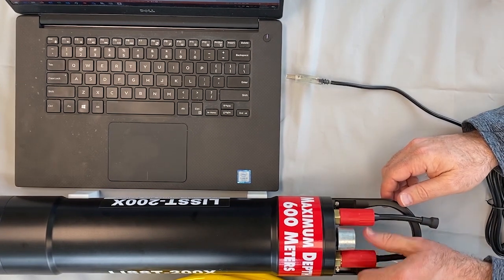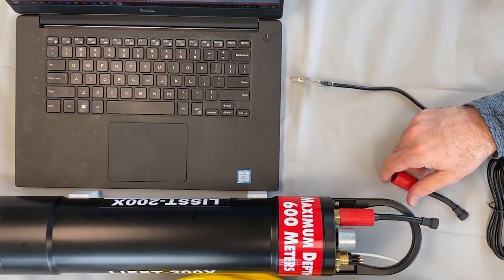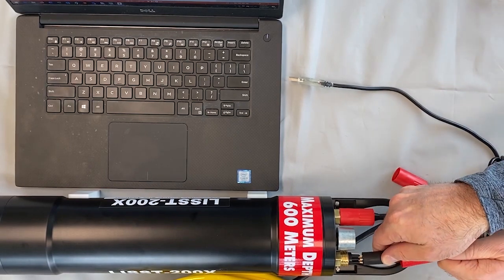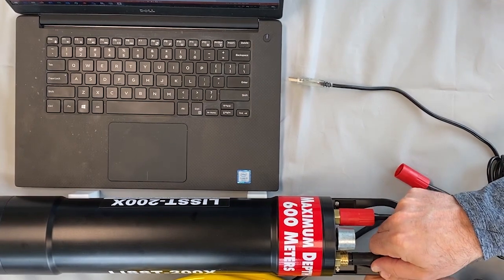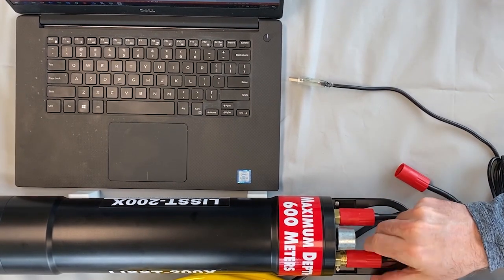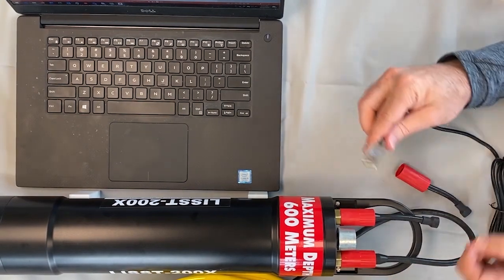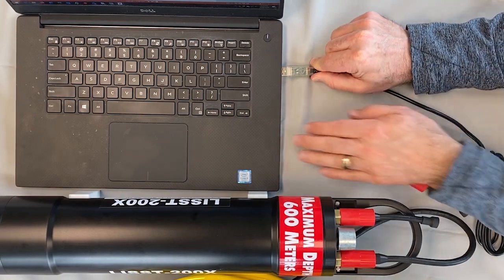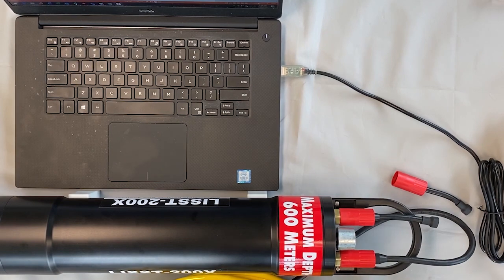Loosen the red locking sleeve and pull the protective cap straight off the bulkhead connector. The communications cable has a 5-pin connector that mates with this bulkhead connector. Orient the cable to line up the pins on the bulkhead connector and push the cable fully onto the connector. Install the locking sleeve hand tight. Insert the USB end of the communications cable into the USB port of the computer. You should see a light flash on the cable and may hear a sound on the computer as the USB connection is established. The first time the cable is connected, some drivers may need to be automatically installed.